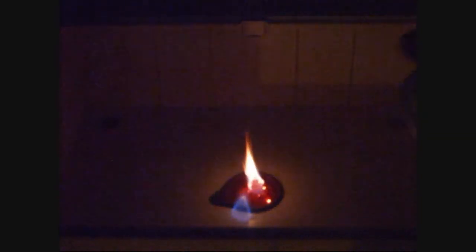To start the decomposition reaction, a few drops of acetone are added to the top of the pile and lighted with a Bunsen burner. The decomposition reaction starts immediately and leaves a fluffy residue of chromium compounds like chromium oxides, chromium chromate, and some residues of ammonium dichromate.